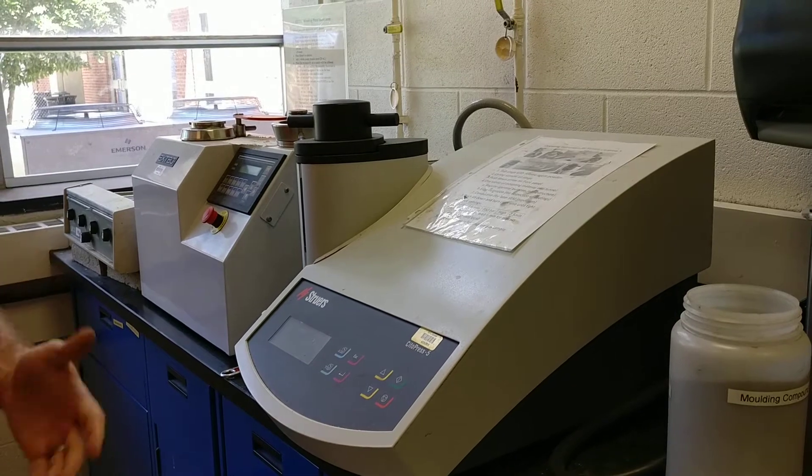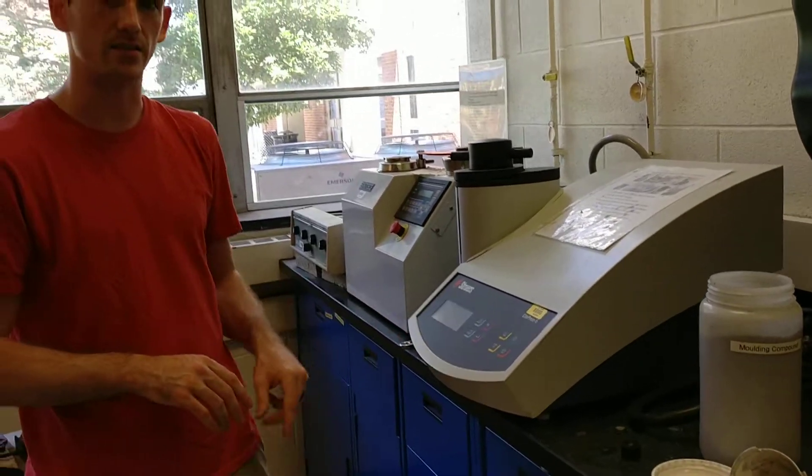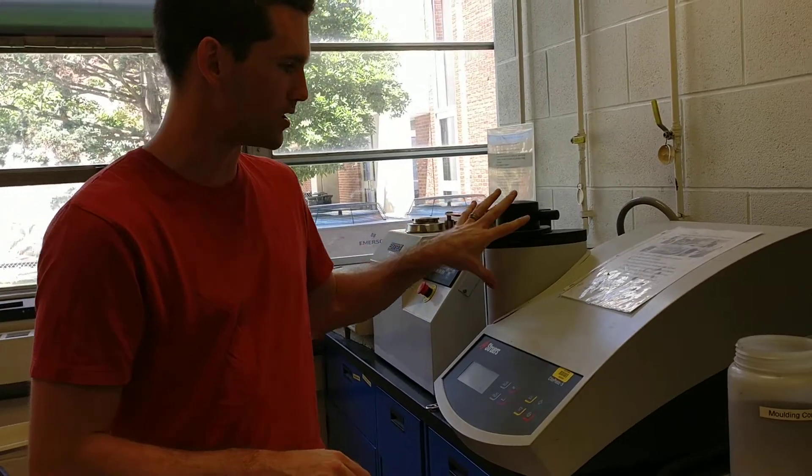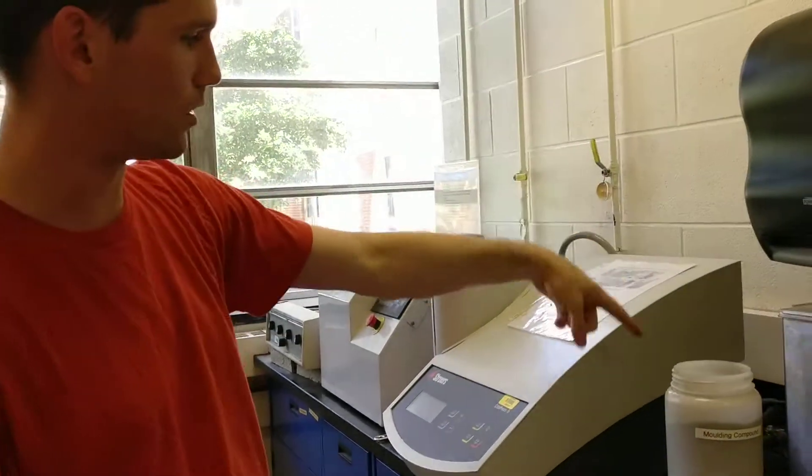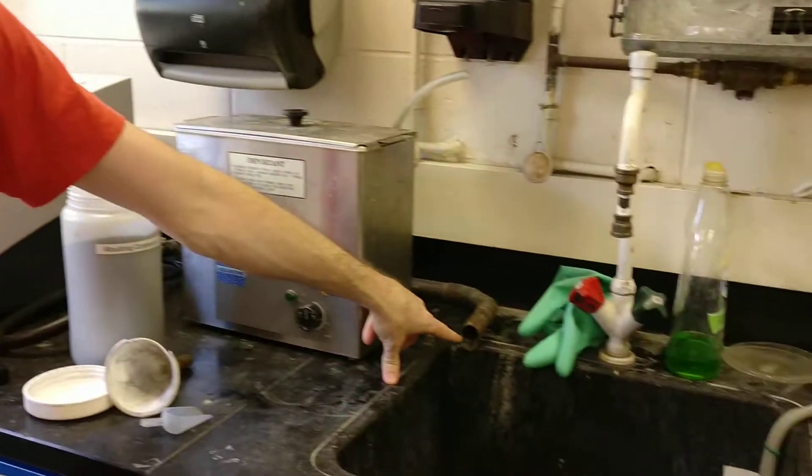It will apply some pressure, apply some heat. It's going to take six minutes total. It is water cooled so the water will come out back and then drain into the sink.